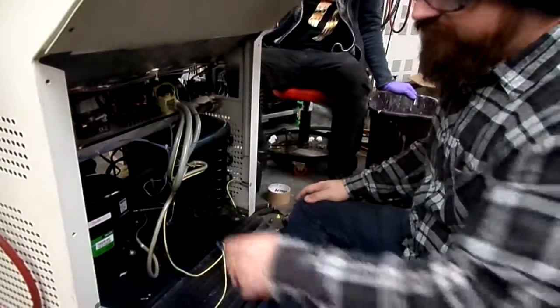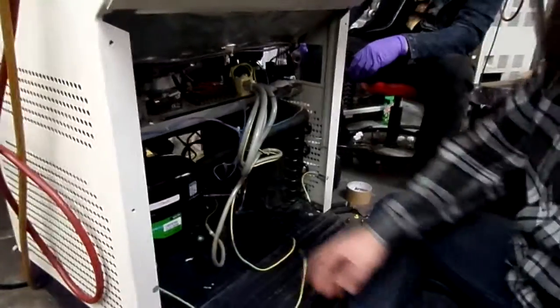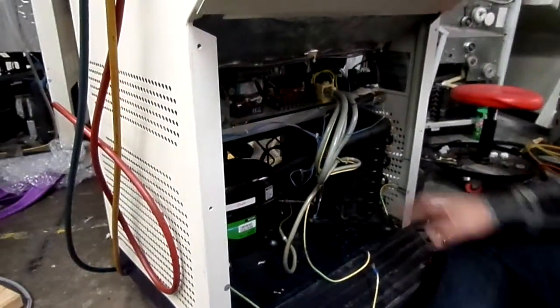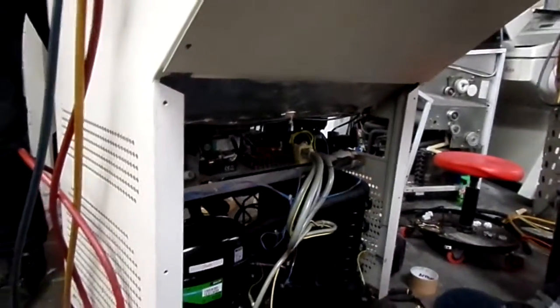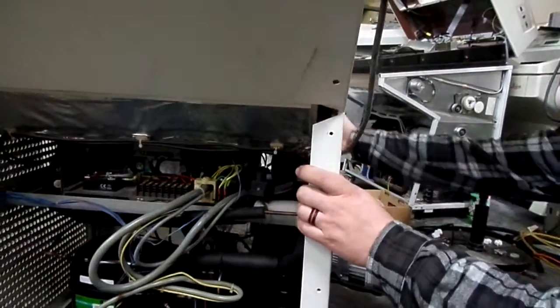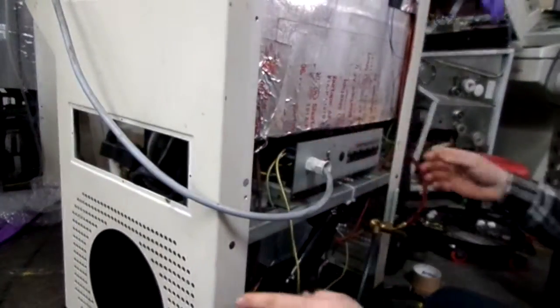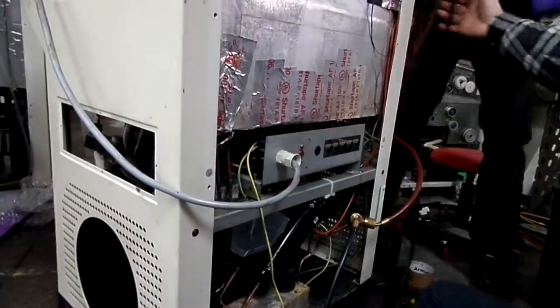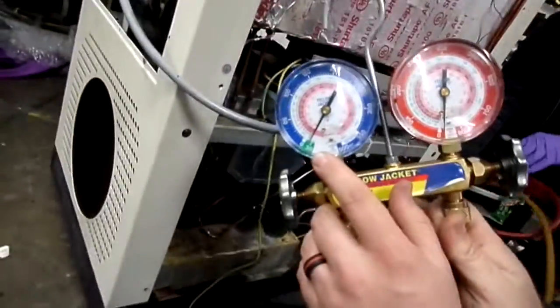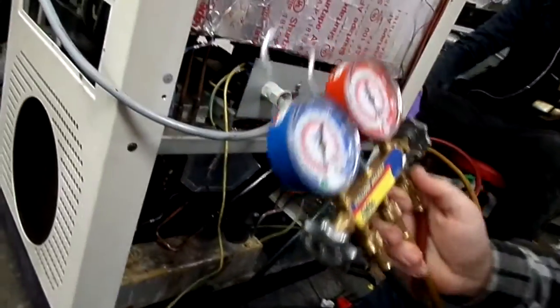Alright, now that we got everything buttoned back up, we've got the new fan motor installed, new compressor obviously, and we have all the tubes just wrapped up, and the sensors are where they need to be. Now, it's time, and it's been on the vacuum pump the entire time we've been wrapping it up. So it's got a nice, solid negative pressure, aka vacuum, inside of the machine.